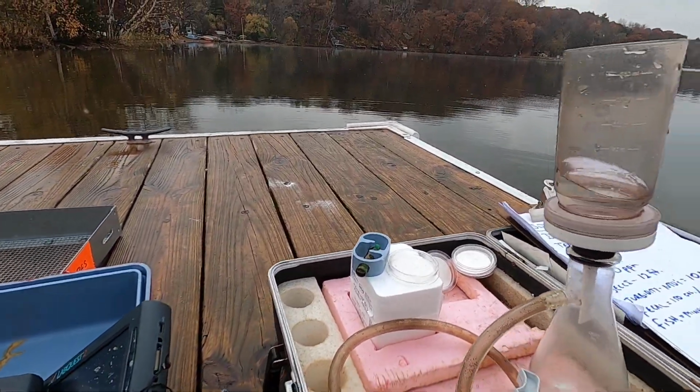And then lastly, this is a cool one. Oh, don't go fall in the water, it'll sink. So this last test is how we measure poop. As I was walking along the beach, I saw a bunch of goose poop. Probably shouldn't eat it. But we have this machine here. It's called a Buchner filter, or it's also called a vacuum filtration technique. And here's how this works.